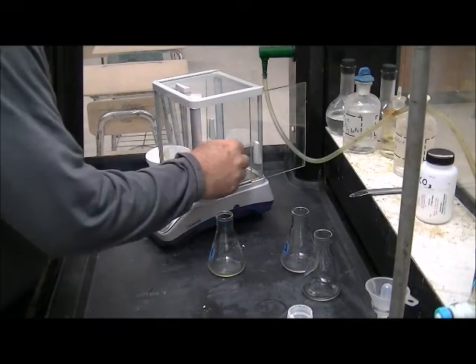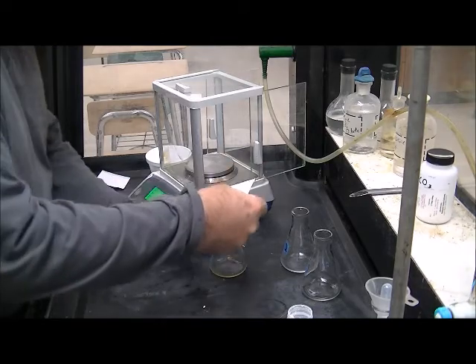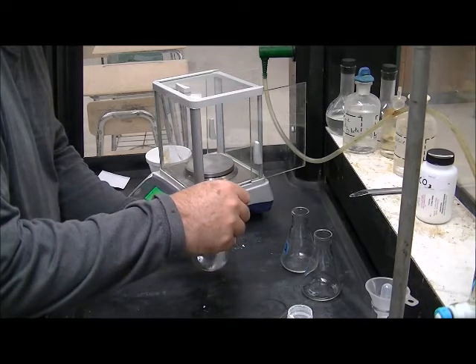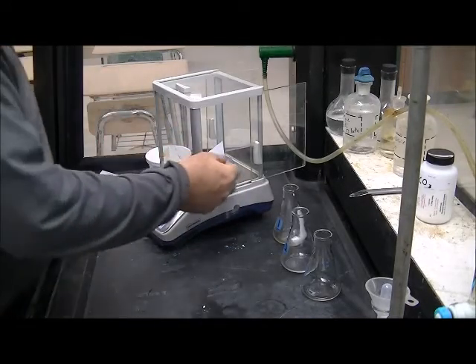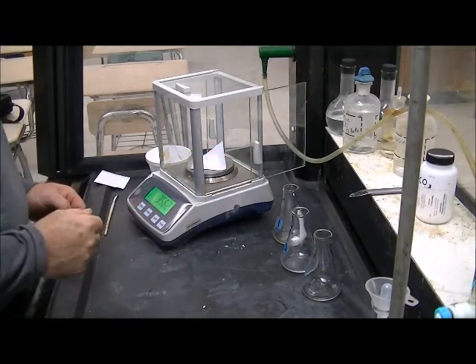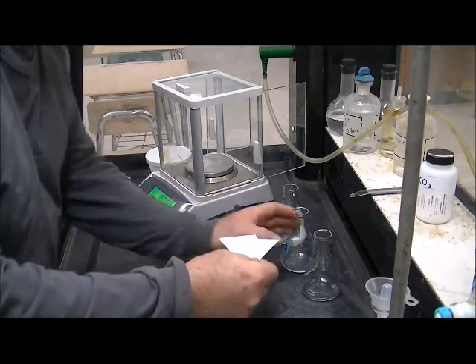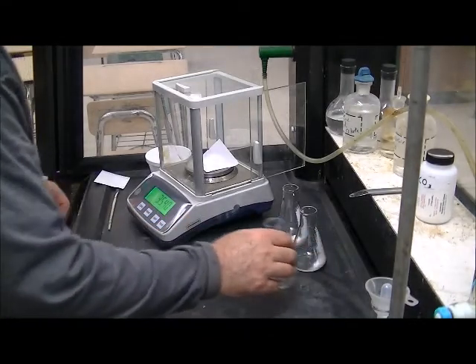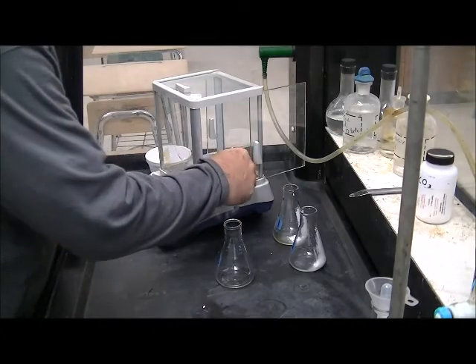This is unknown D, sample 1, 3.551 grams. D, sample 2, 3.562 grams. D, sample 3, 3.540 grams.